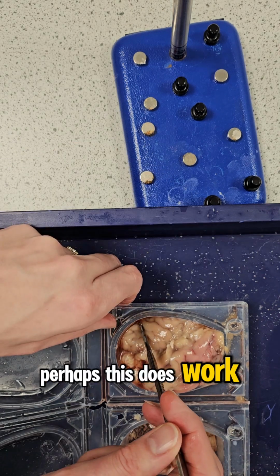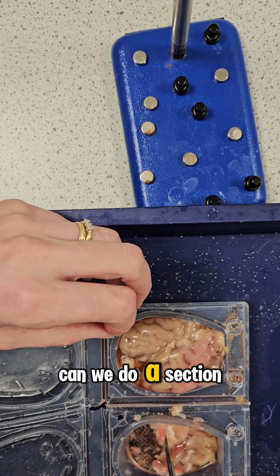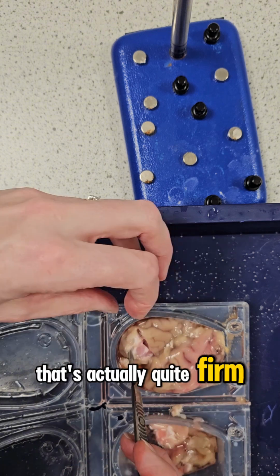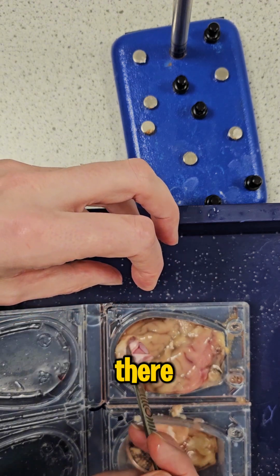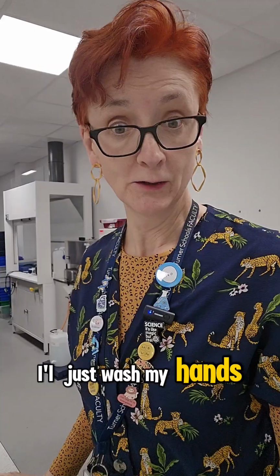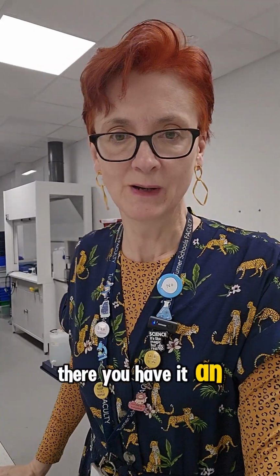Perhaps this does work. Can we do a section? I mean, bear in mind this has been in the fridge for 2 days. That's actually quite firm. Yes, it has worked. So there. Look at that. It is firm. I just washed my hands. There you have it. An unexpected result.